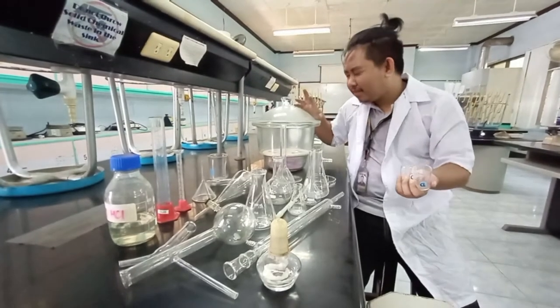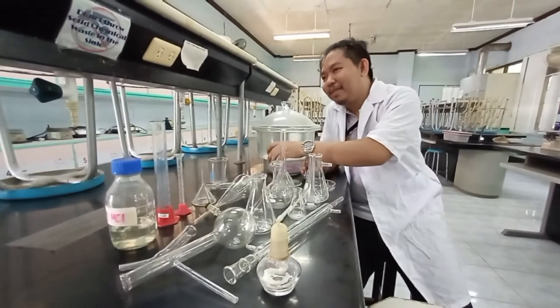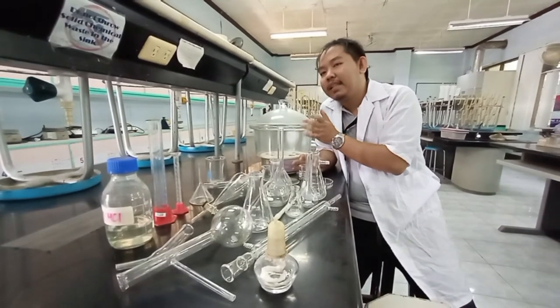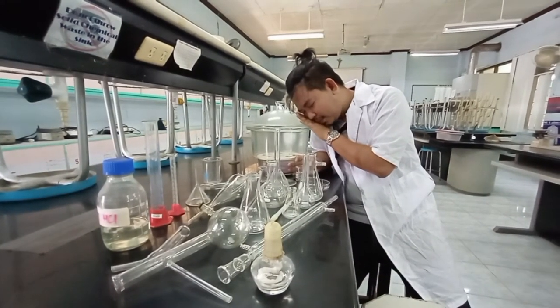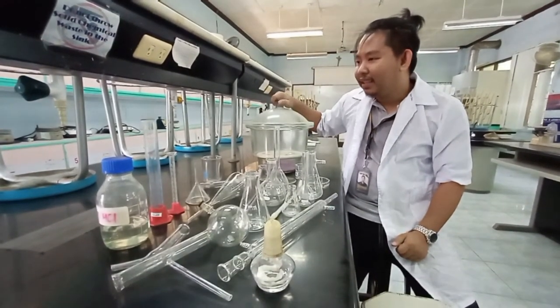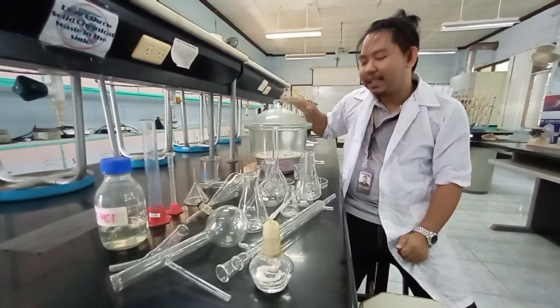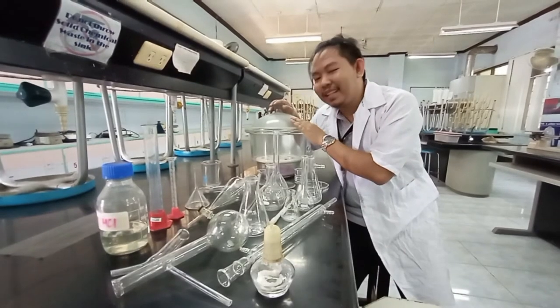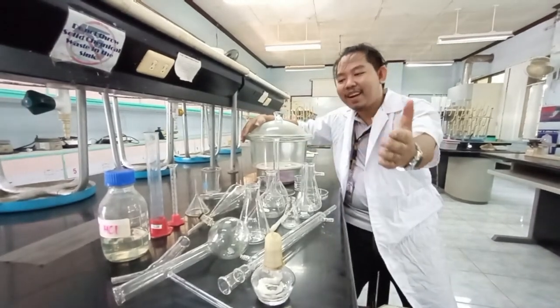And finally, we have this item used to dry some things. The name slipped my mind — comment down below what it's called to check if you're watching. So, what is the name of this glassware? It is actually a desiccator, as we'll confirm shortly. These are your glasswares.